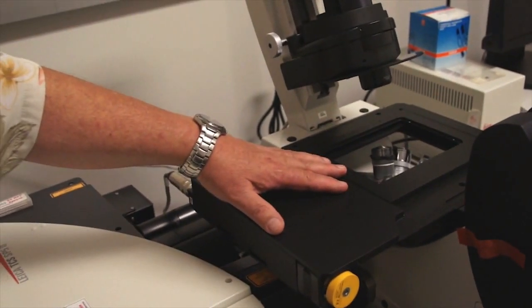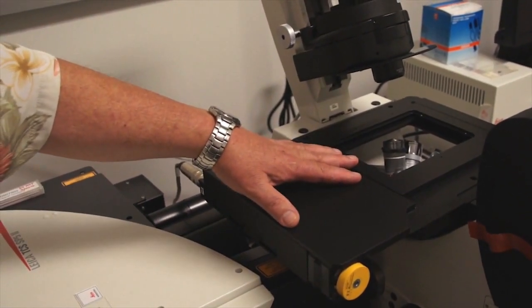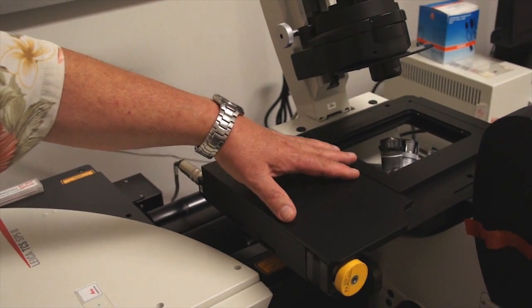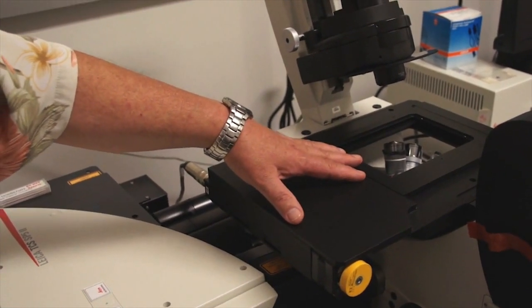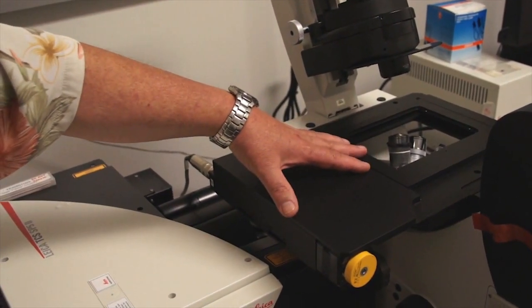So be aware that this is a robotically controlled motorized stage which can injure your fingers. You could actually lose a finger if you put your hands in here while the stage is moving.